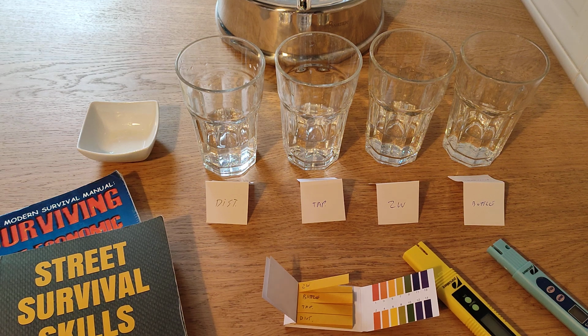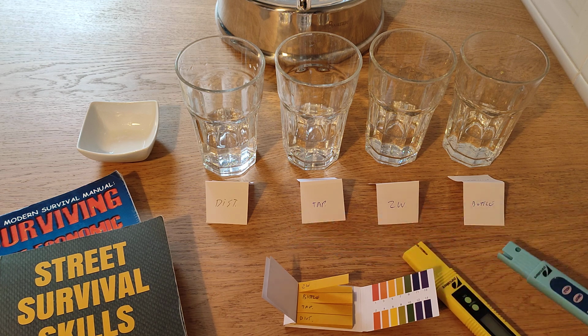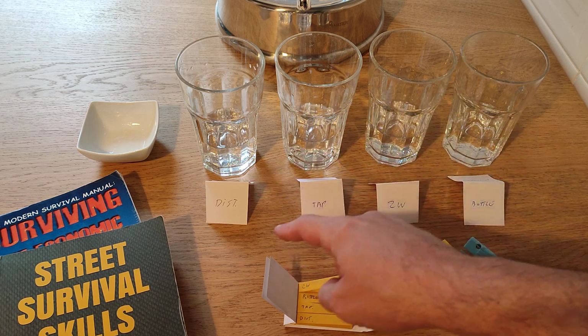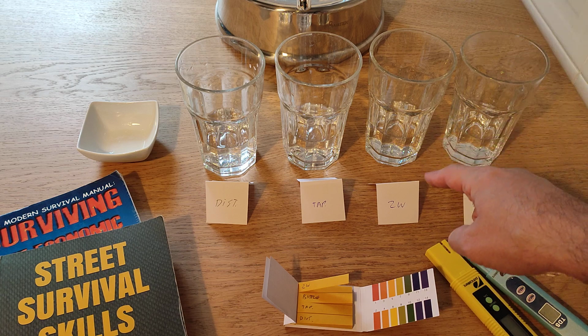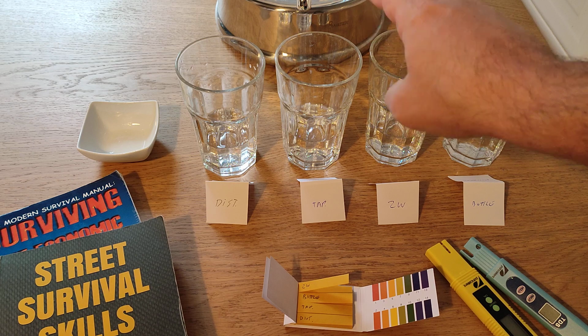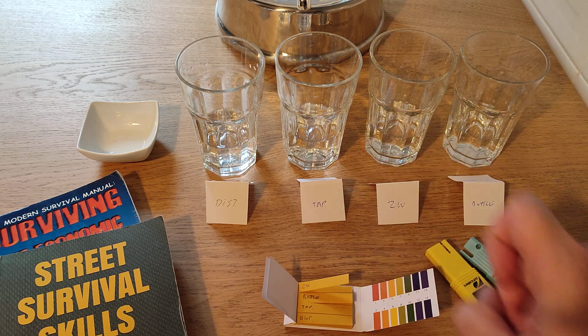Hey folks, this is Fernando doing another video for the more survivalists, and in this case we're going to be comparing the TDS, total dissolved solids, particles in water, and the pH from distilled water, tap water, zero water, and bottled water. Zero water is going to be filtered with that zero water filter from that tap water.